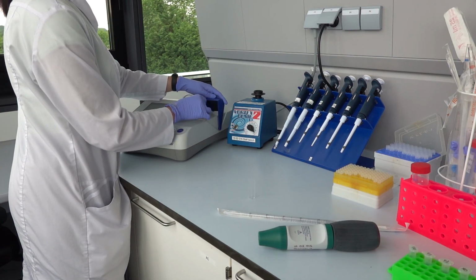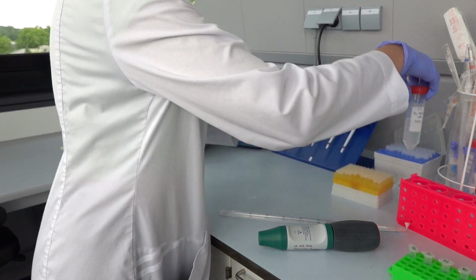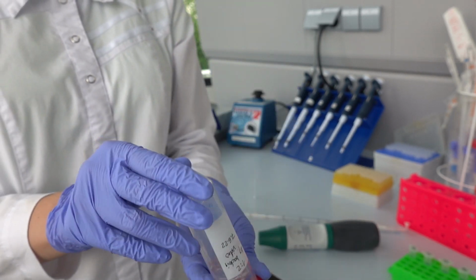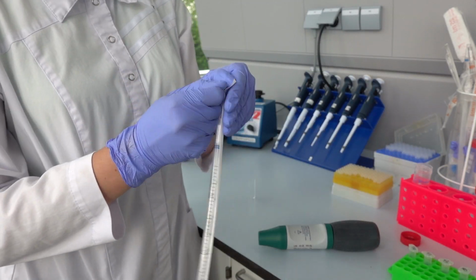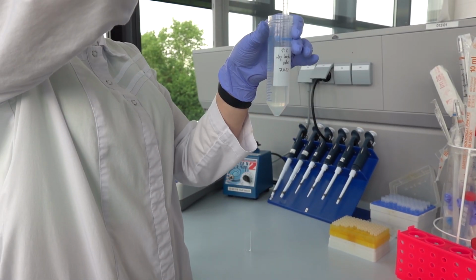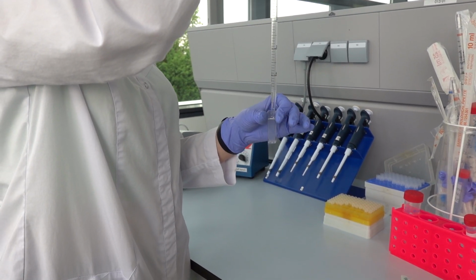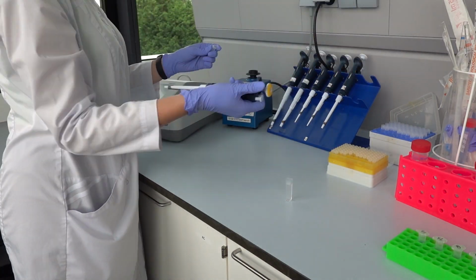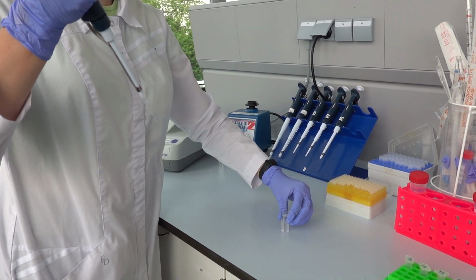After determining the presence of lysozyme, we are proceeding with determining the specific activity of isolated lysozyme, which theoretically should be present in F0, F4, and the positive control samples. 2.5 milliliters of fresh bacterial suspension is added to one cuvette after setting the blank again. 100 microliters of first sample F0 is added and immediately measured for OD at time point T0.